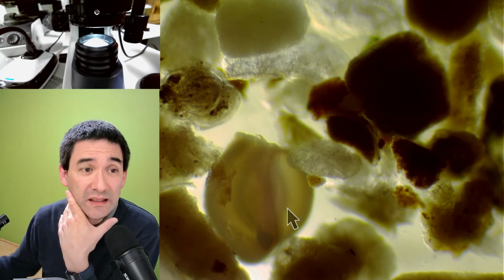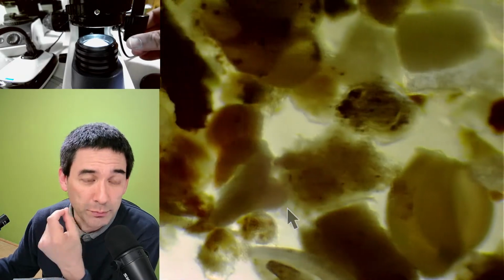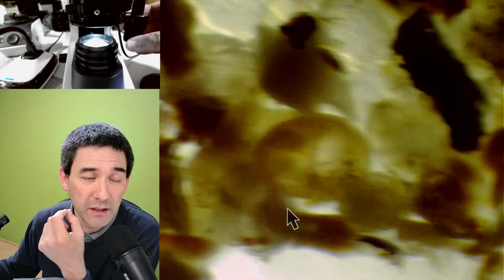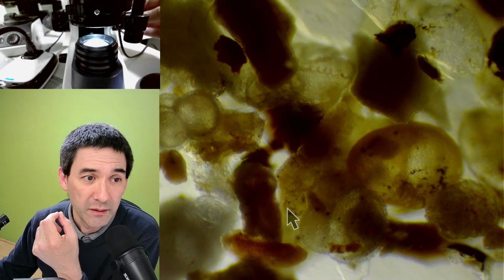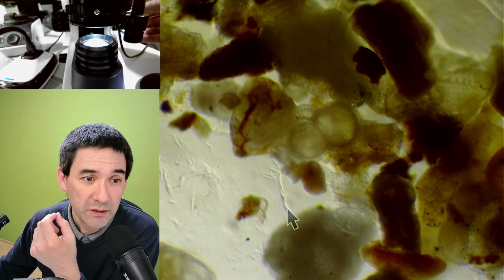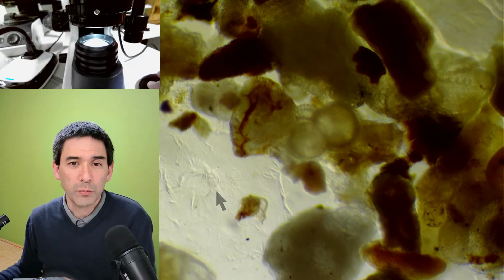Yeah? So that is a little bit the issue. It's actually a geometric problem that, especially if you have a top light, sometimes it will cast a shadow. Yeah? But you see over here the tiny things that look a little bit like oblique. Yeah.